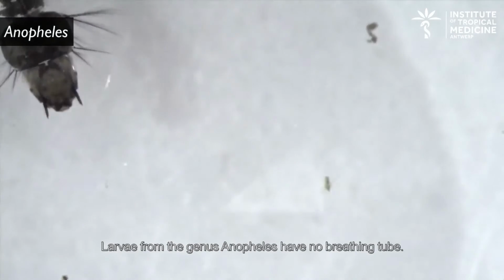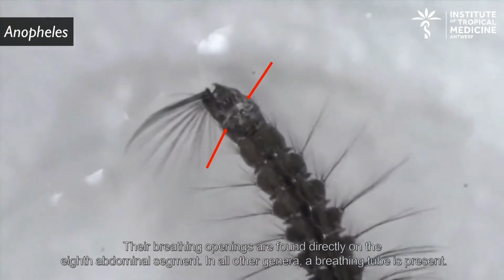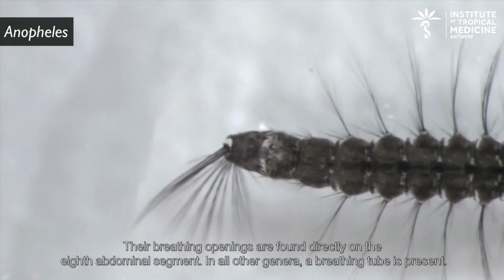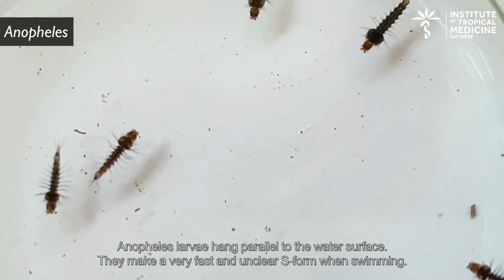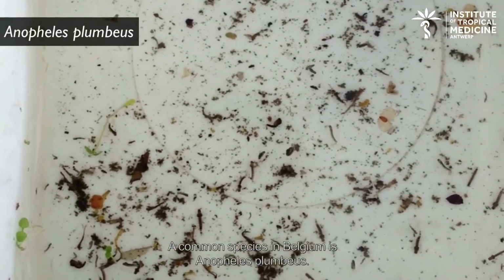Larvae from the genus Anopheles have no breathing tube. Their breathing openings are found directly on the 8th abdominal segment. In all other genera, a breathing tube is present. Anopheles larvae hang parallel to the water surface. They make a very fast and unclear S form when swimming. A common species in Belgium is Anopheles plumbeus.